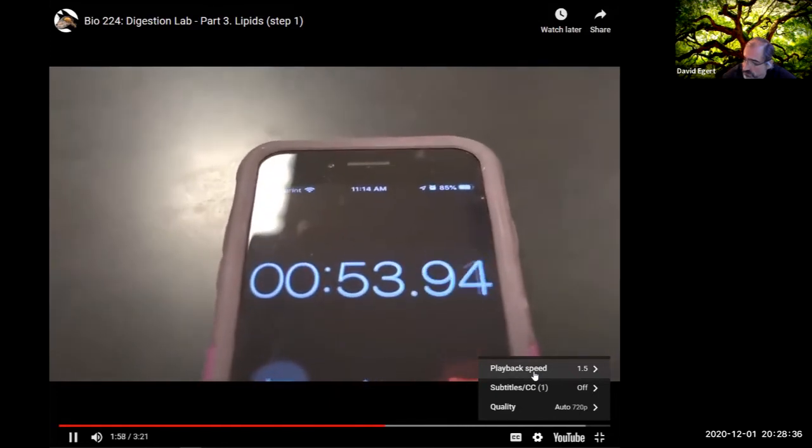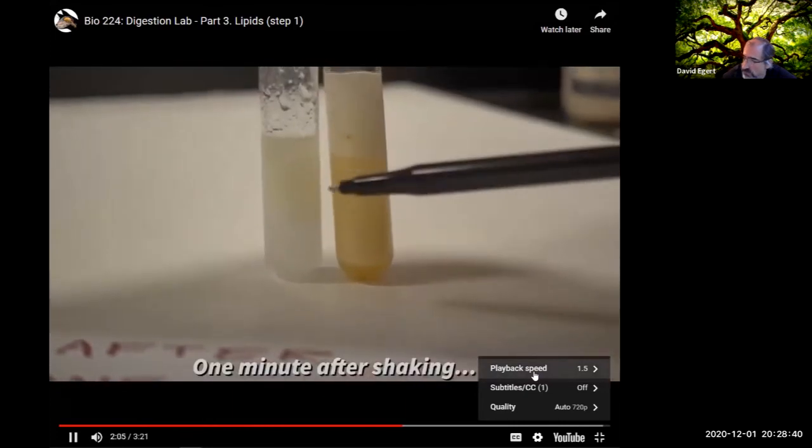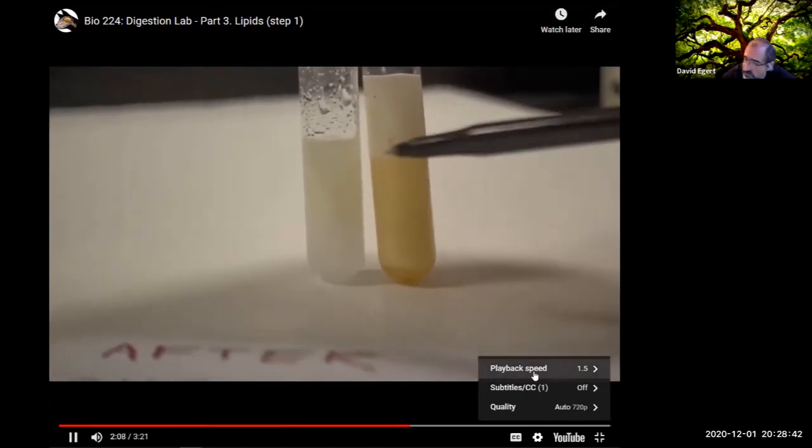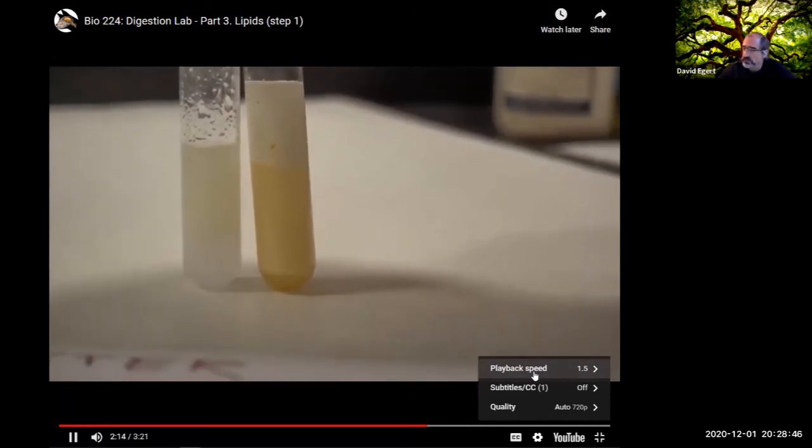Okay, so it's almost 1 minute. So 1 minute, let's take a look at them again. All right, so we waited a minute. You can see the water and the oil starting to separate here in test tube A. In test tube B, we have some foam and some emulsification situation. So we'll wait another minute and take a look at what happens then.